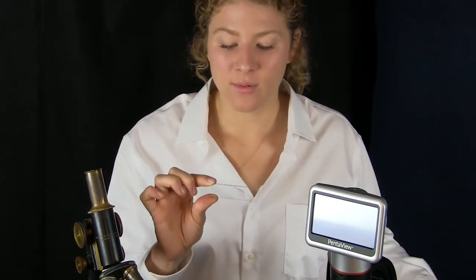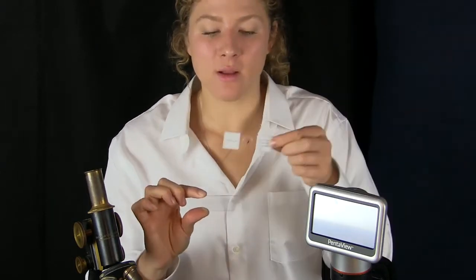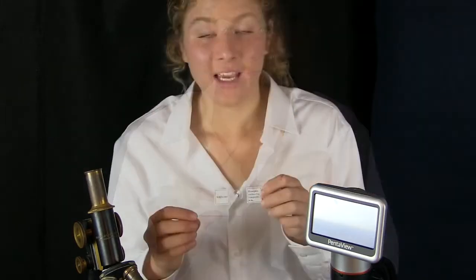A slide is a thin piece of glass, like the one I have here, that we can put cells on and look at through the microscope. This one doesn't have anything on it, but if you look at this one, this has already been made up. Can you guess what's on this slide?